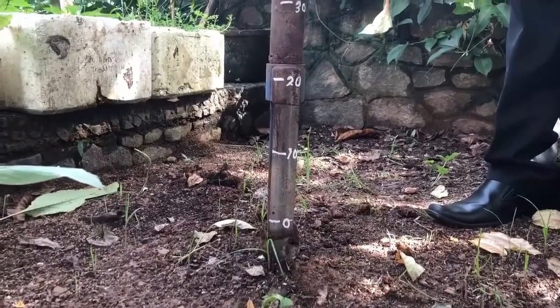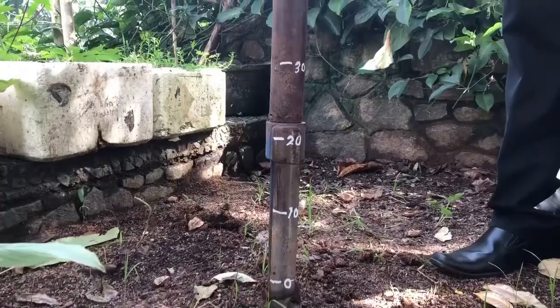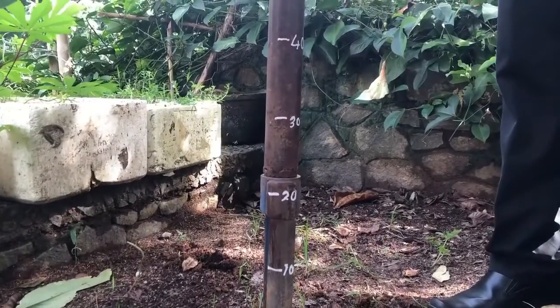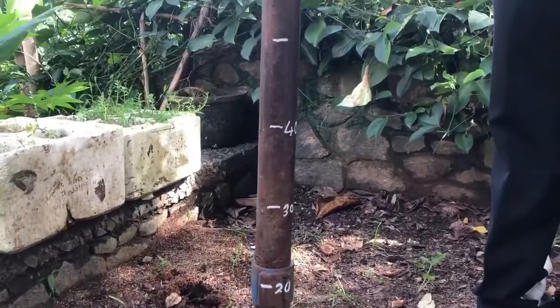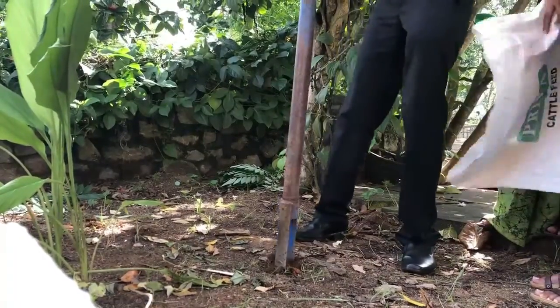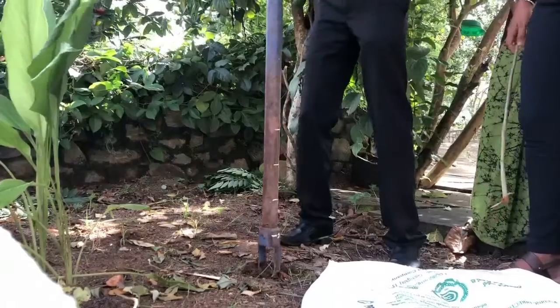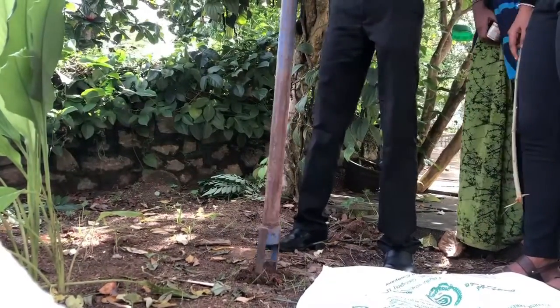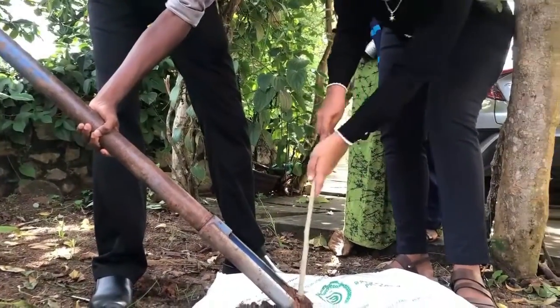Now we are in the field to collect the soil samples. You can see on the soil auger that different depth levels are clearly marked. First, we penetrate the equipment into the topsoil up to 10 cm to collect the soil sample. As it reaches 10 cm, stop screwing and remove the equipment from the soil, then slowly collect the sample into the poly bag.